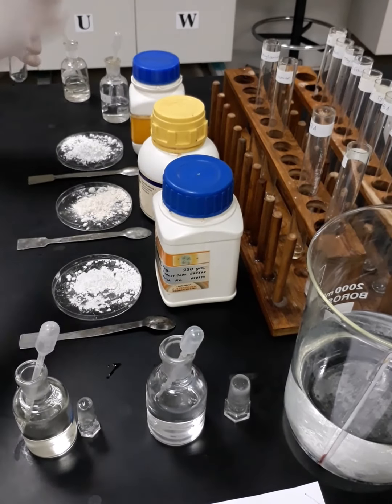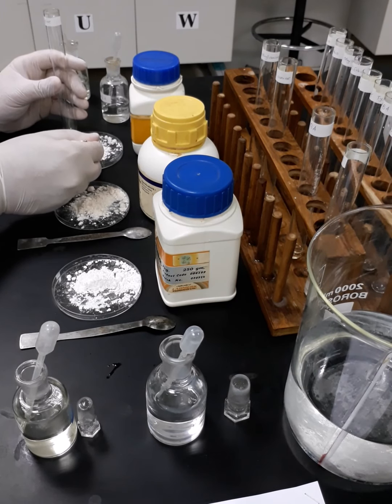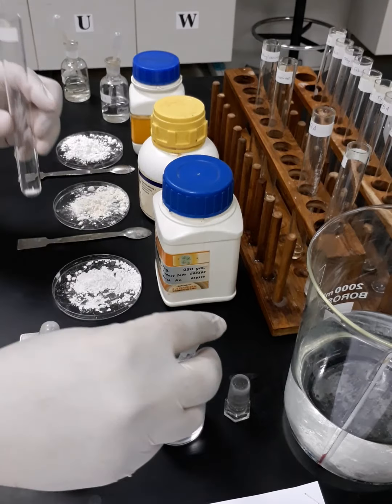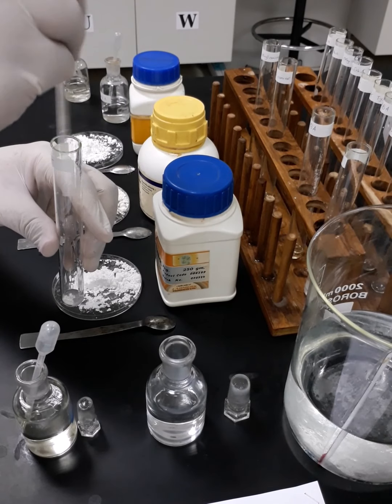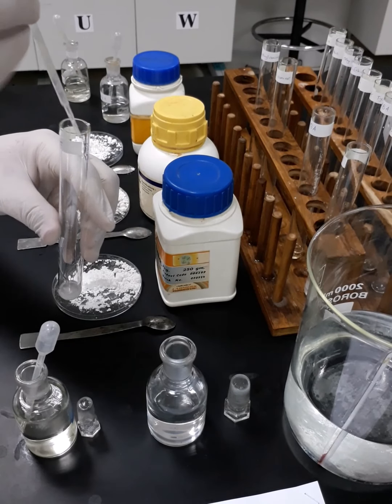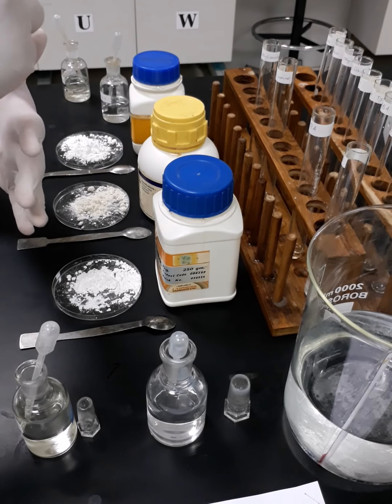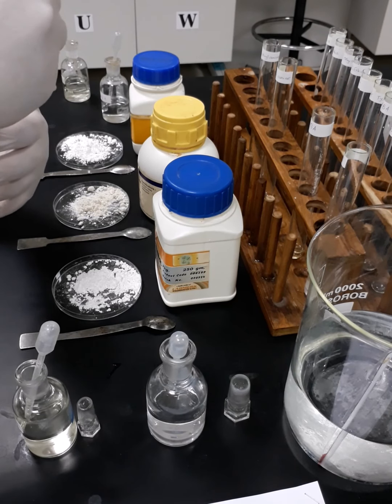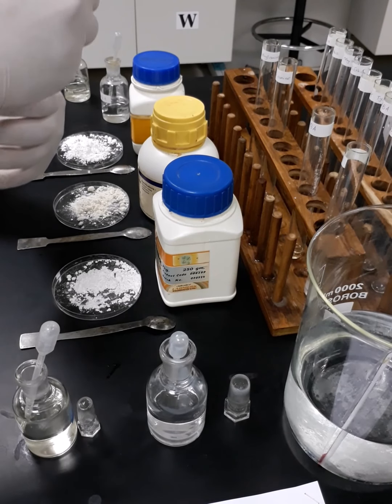Okay, now we're going to proceed with tyrosine. 0.25 gram, the same. Of course, we have to consider the density. Then we are going to add once again 2 ml of HCl solution. We expect that HCl can solubilize the tyrosine, but it will take more time. Solubility here is not a matter for me, because the aim of addition of HCl not to make the sample soluble. No, it will be reacting with the sodium nitrite to produce nitrous acids.